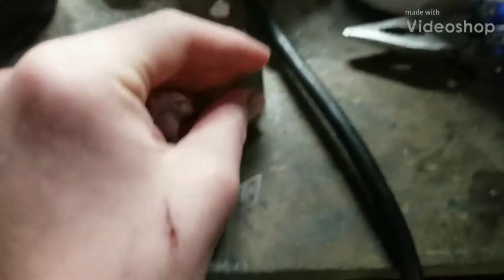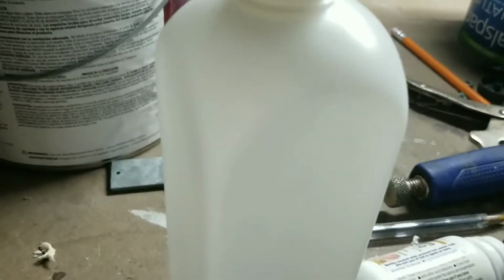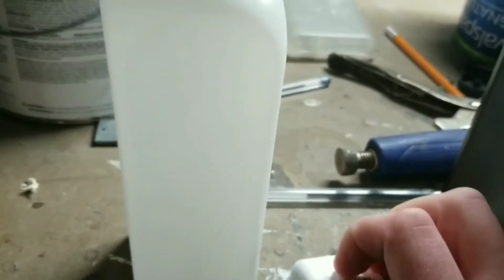If you remember my very first video on this channel, I made a video on how to convert baking soda into sodium hydroxide using electrolysis. But unfortunately, I actually took apart that electrolysis rig because it was an open top, which meant a lot of things. First things first, it leaked deadly hydrogen gas. Second, it used a salt bridge, which is a relatively inefficient method for a double cell electrolysis rig. Nowadays, people use membrane cells, which are much more efficient.